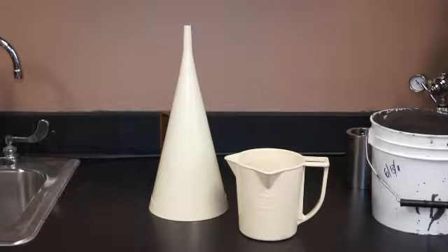Okay, today I'm going to talk about one of the most commonly used items that a mud engineer ever uses. Basically, it's called a Marsh funnel and a measuring cup. This is for crude testing of viscosity, relative viscosity that is. It was developed and invented by Dr. Marsh back around 1935 and has been used extensively ever since.